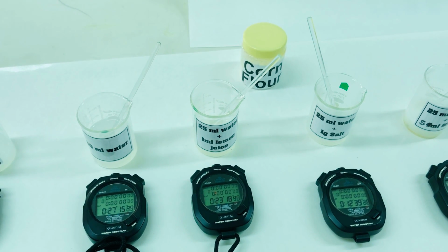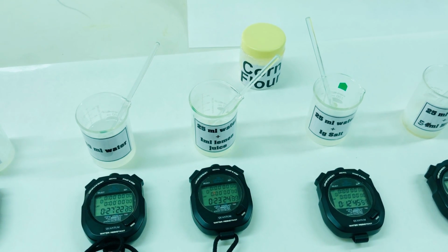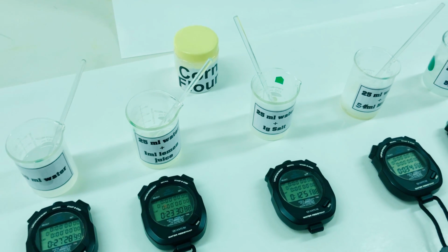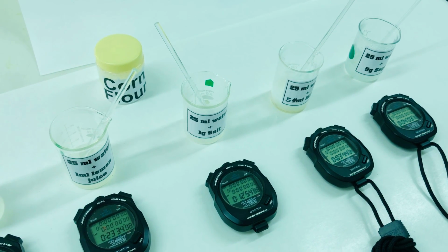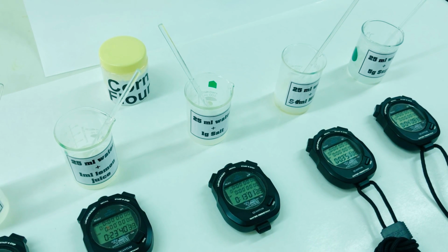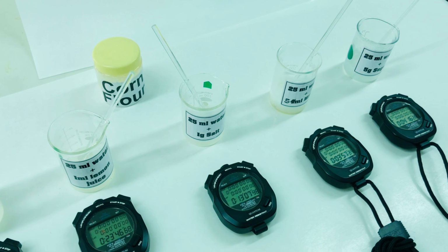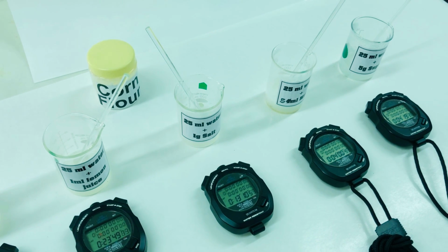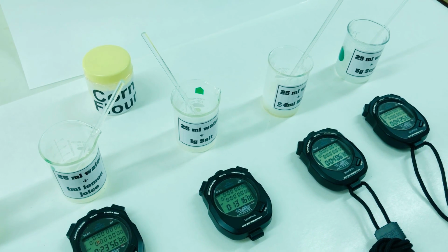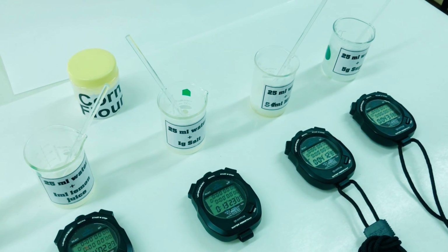What is observed is that lemon juice slows down the process of gelatinization, whereas there is no effect of salt seen on the process of gelatinization. The other 2 factors which we have assessed are addition of 5 grams of sugar and 5 ml of milk. Addition of milk, because milk is a protein, has unpredictable effect. In this case, there is formation of a smooth gel, whereas addition of sugar also retards the process of gelatinization.